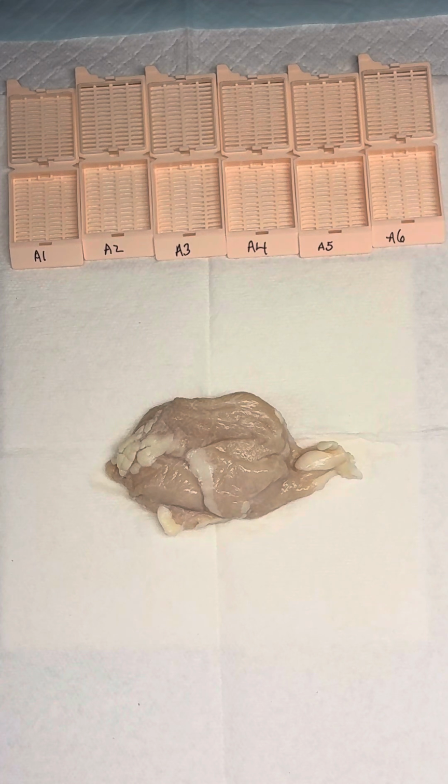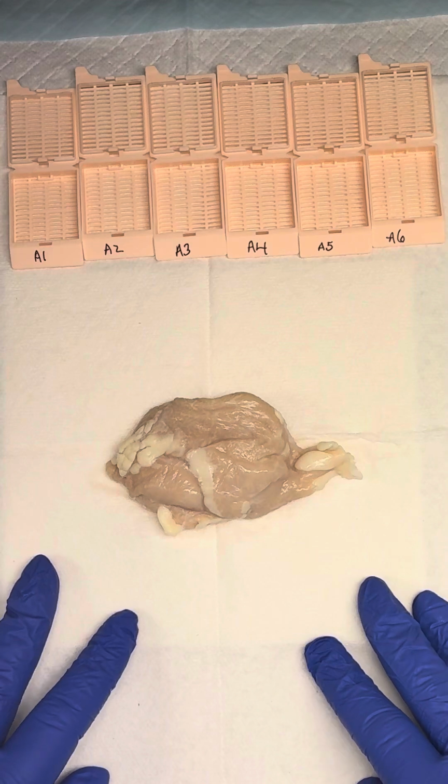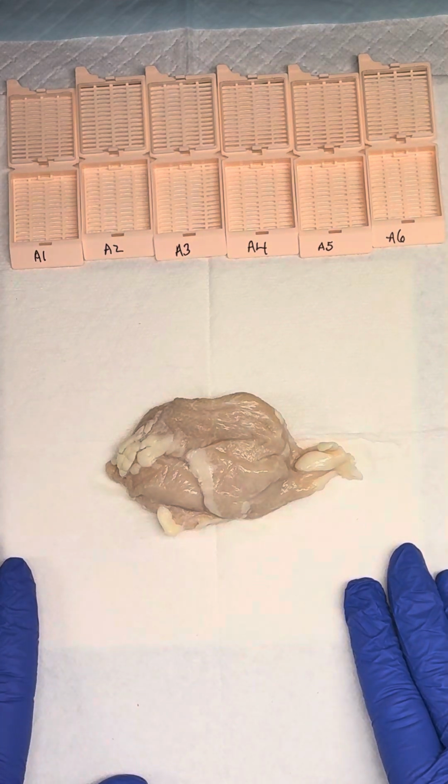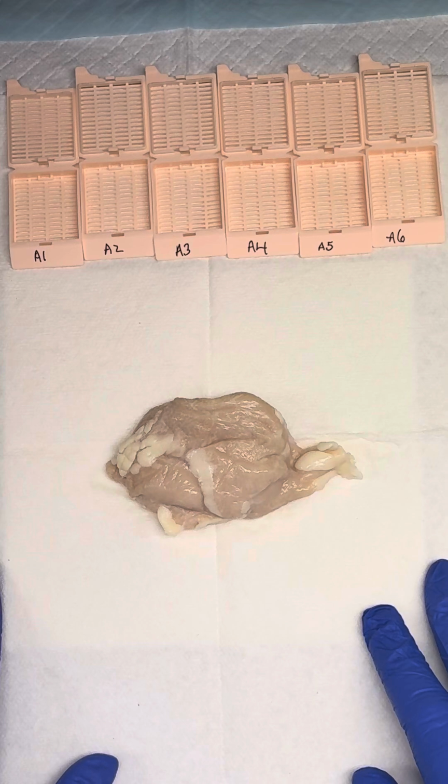So orientation wise, there's not a ton of orientation for thymectomies or thymi in general. If your surgeon provides you orientation, that is super helpful, or if you have some adherent structures, that might help you determine orientation. In this instance, we received our thymectomy fixed and it doesn't have any orientation. So we're going to proceed as an unoriented thymectomy specimen.